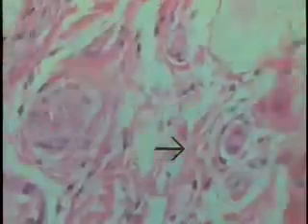The last two vessels as seen at increased magnification. A small artery making up maybe 3 muscle wraps, showing the tunica media, and this is the arteriole at this particular location that has 1 smooth muscle wrap associated with it, a smooth muscle cell located here and 1 here. So this gives you a comparison of a terminal small artery at this point and an arteriole located at the tip of the arrow.